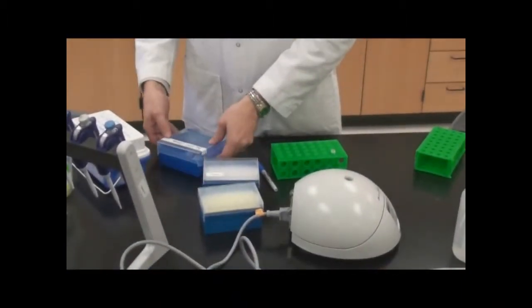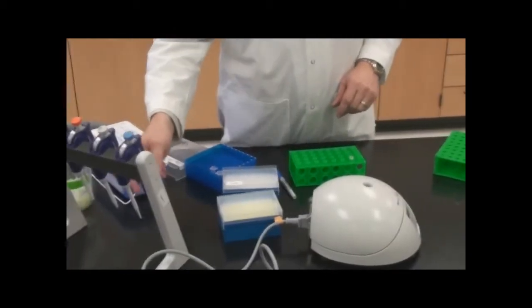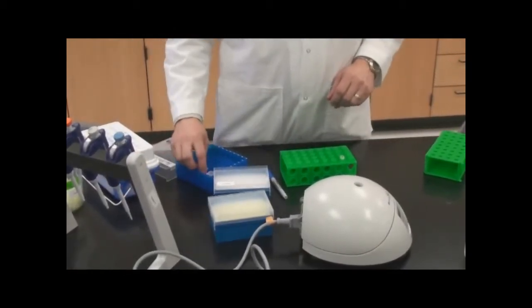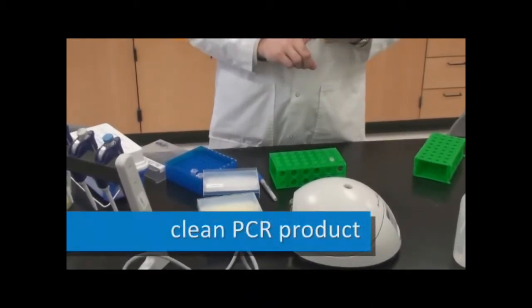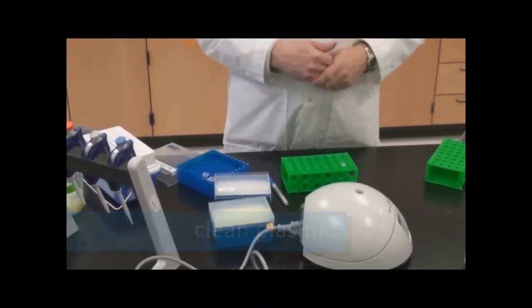So I'm going to set it here. We've got the ligation buffer in there, we only need really three other components for our ligation, and that's going to be clean PCR product, clean plasmid, and then adding our enzyme.